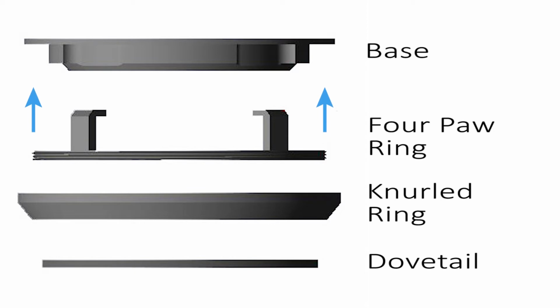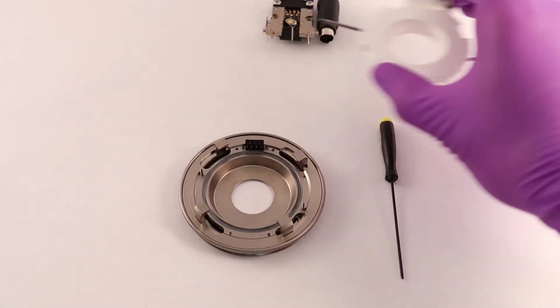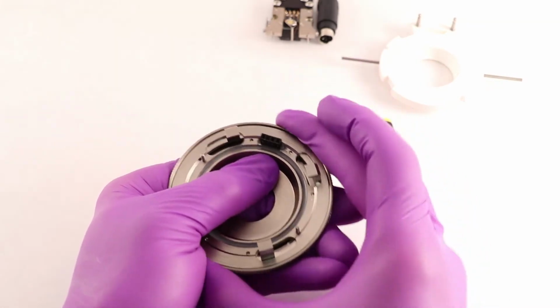When tightening or closing the chamber with no white top, the 4-paw ring may make contact with the base of the chamber, or when opening or loosening the chamber, the 4-paw ring may make contact with the dovetail. Once the chamber is fully open or closed, stop rotation. If rotation force is put past these stops, then the 4-paw ring will bind, therefore causing the chamber to become stuck.